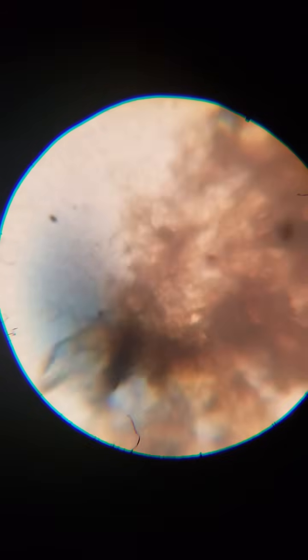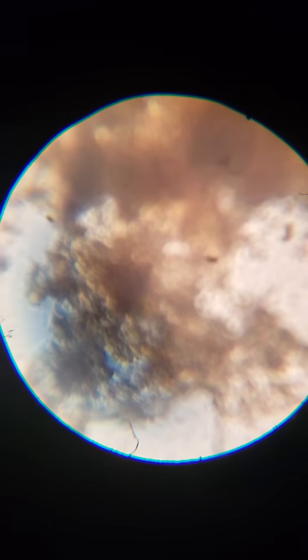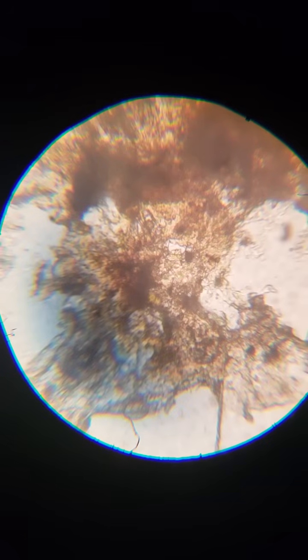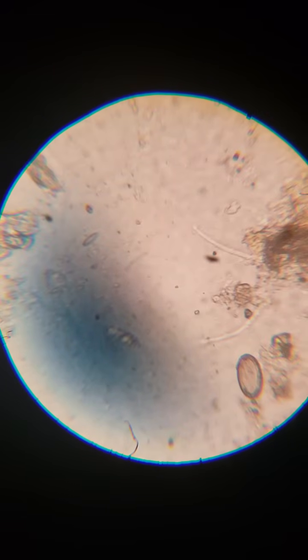Right here you can actually see the bacteria building up, and its cells are so much teenier than human cells that basically when we're at the level that human cells look like the size of, I don't know, a pea on the screen or something, or one of those dark areas in the center there, you can see that their cells look so teeny. They still look like they're at the first level of magnification. So you can see some sponge cells there.